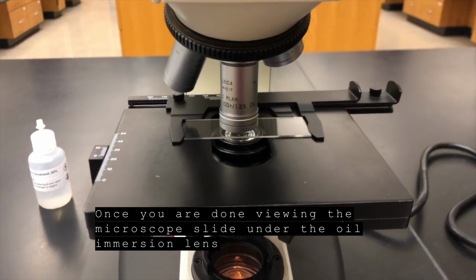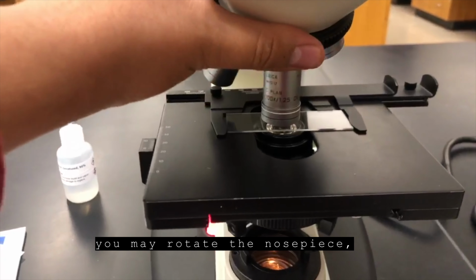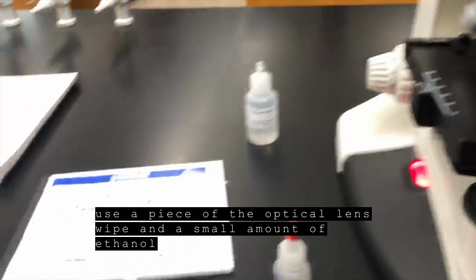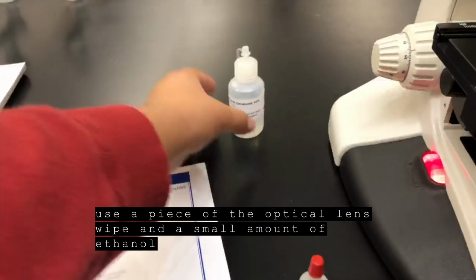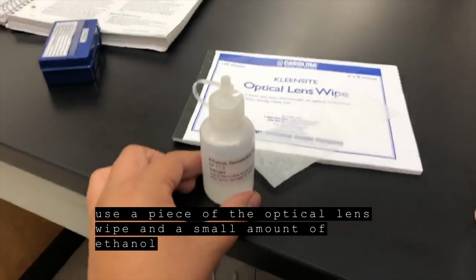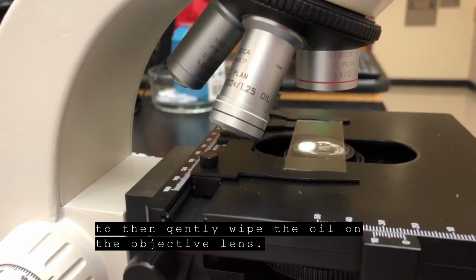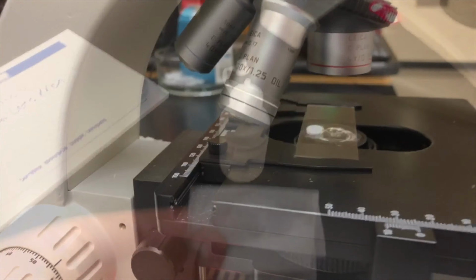Once you are done viewing the microscope slide under the oil immersion lens, you may rotate the nose piece. Use a piece of the optical lens wipe and a small amount of ethanol to then gently wipe the oil on the objective lens.